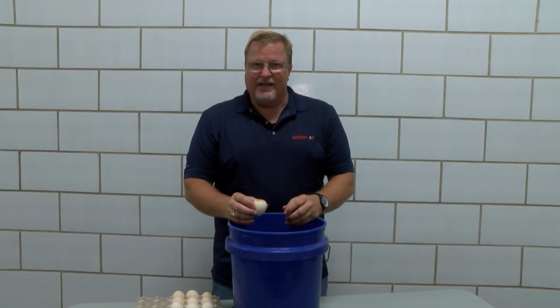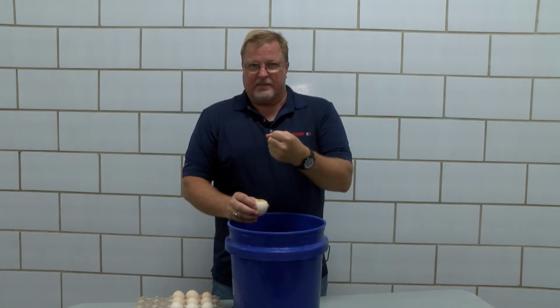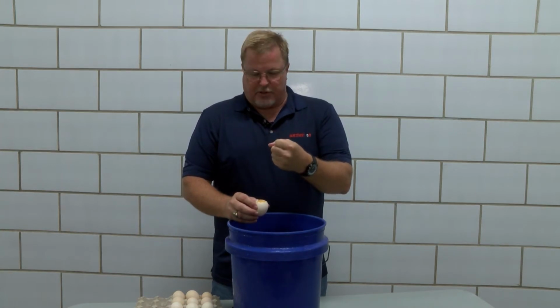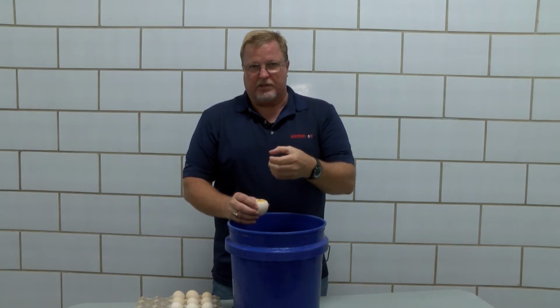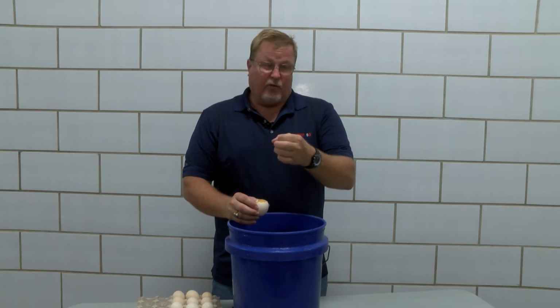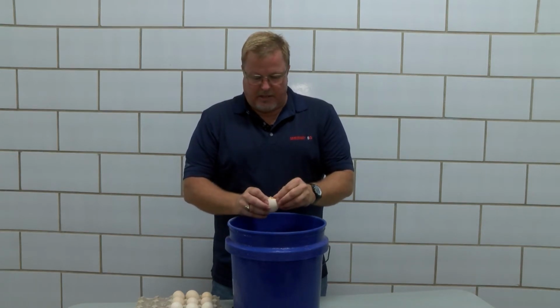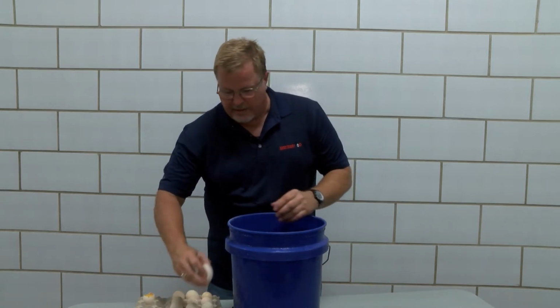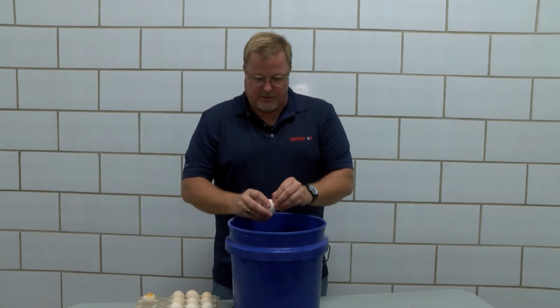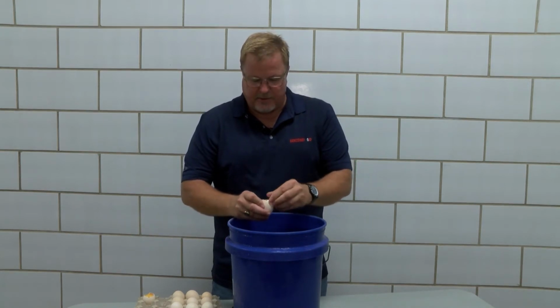An infertile egg is going to have a very tight, compact, white mass around that germinal disc area. If fertility occurred and there's any development from that, we start to see a donut-shaped ring over that germinal disc area, because that's where the embryo will continue to grow. So we look at the egg, make a determination. That is an infertile egg. Again, most of these will probably be infertile eggs, unless we've got some other issues.